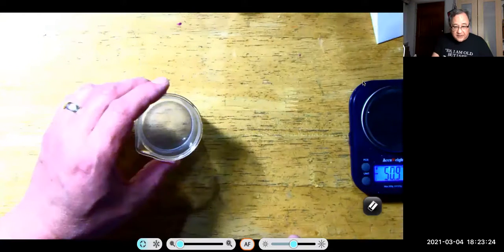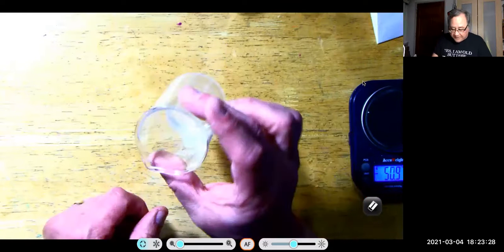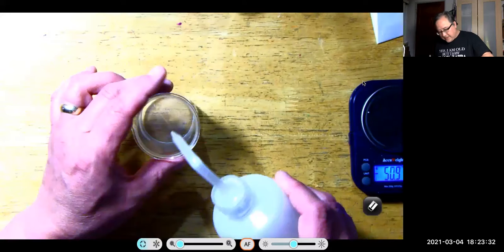So the reason I remove my paper is so that you can see whether or not the solution is clear or cloudy. And it's getting pretty clear there. I'm just going to add a little more water. Now, you might be wondering, well, why am I not stirring this with my stir rod? And the answer is, if I stir it with my stir rod and I pull it out and there's a drop of solution on it, that drop will have carbonate ion in it, and I'm taking it away from the solution. So I'm not going to stir this with my stir rod.